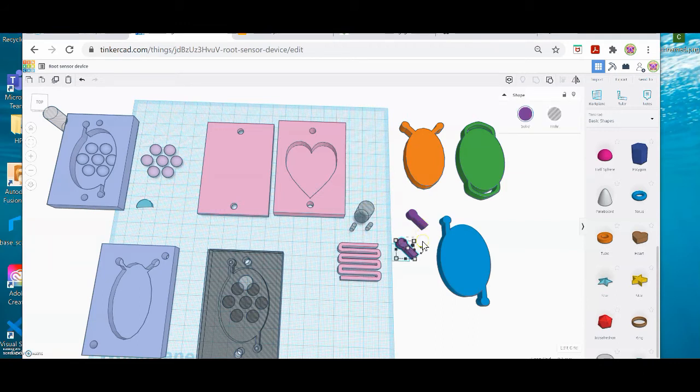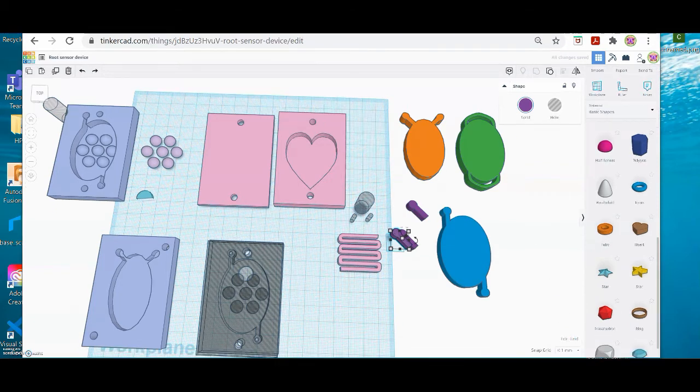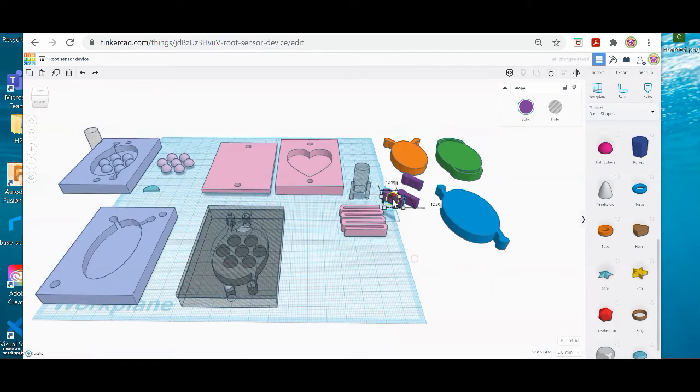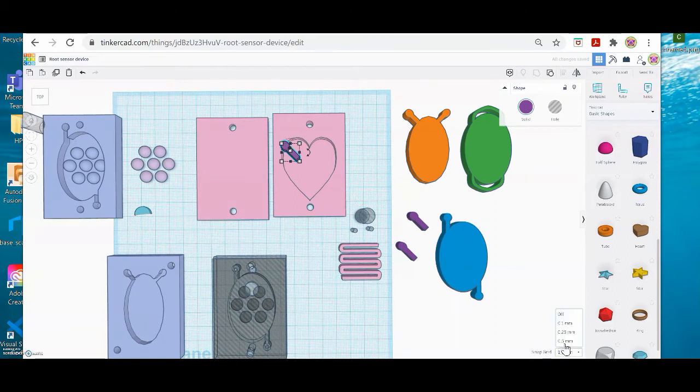I'm going to Control C, Control V, and then I'm going to just use my cursor, my arrows to move it around. Whoops. And down here in Edit Grid, let me move my whole view up. Where it says Snap Grid, I can make it 1 millimeter, so that when I move it, it has bigger jumps. Whoops, I keep doing that. Oh my goodness. Let me turn sideways a little bit. Okay, there we go. If I want to move it in smaller increments, I can move the snap grid to like 0.25. And that way when I use the arrow keys, it moves a little bit less.